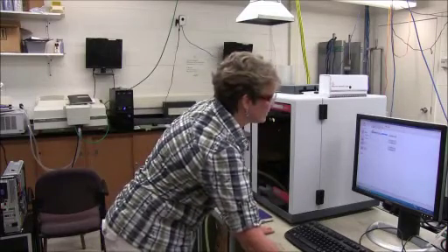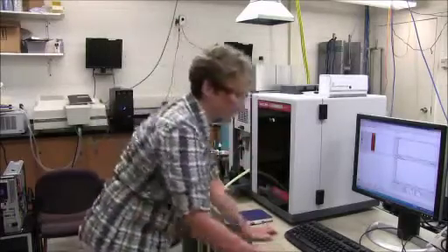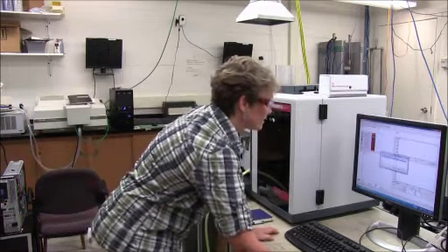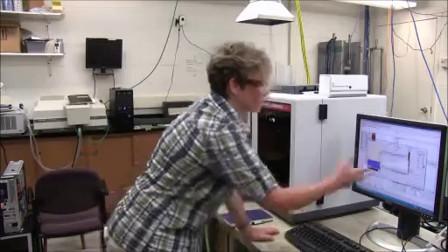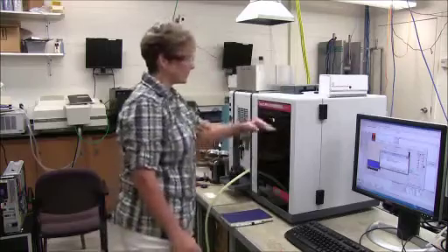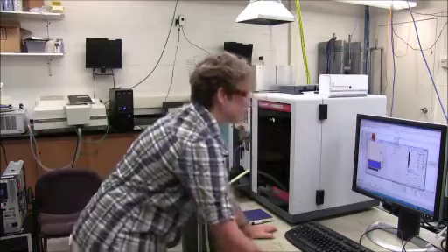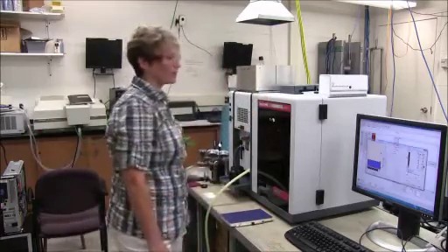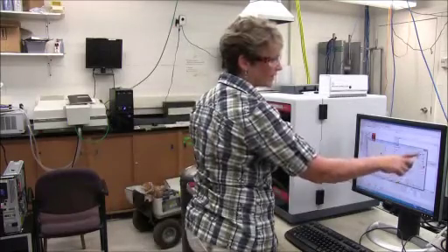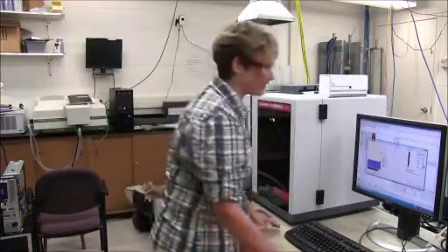On other instruments, you may have a different interface to do the optimization, but for this one, it's done through help from the software. So it's asking me to check that the lamp turret is in the position of the lamp I want, and that my fuel and airflow is set properly. And again, if you see on here, you'll see where the red indicators are is where our gases should be set, and that's exactly where we have them.